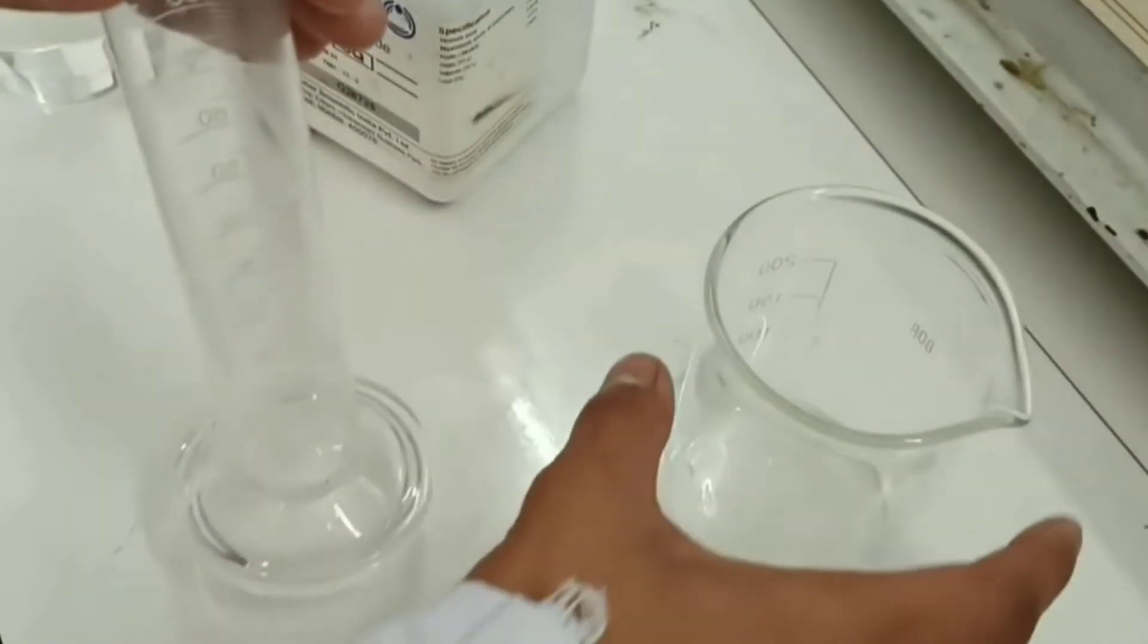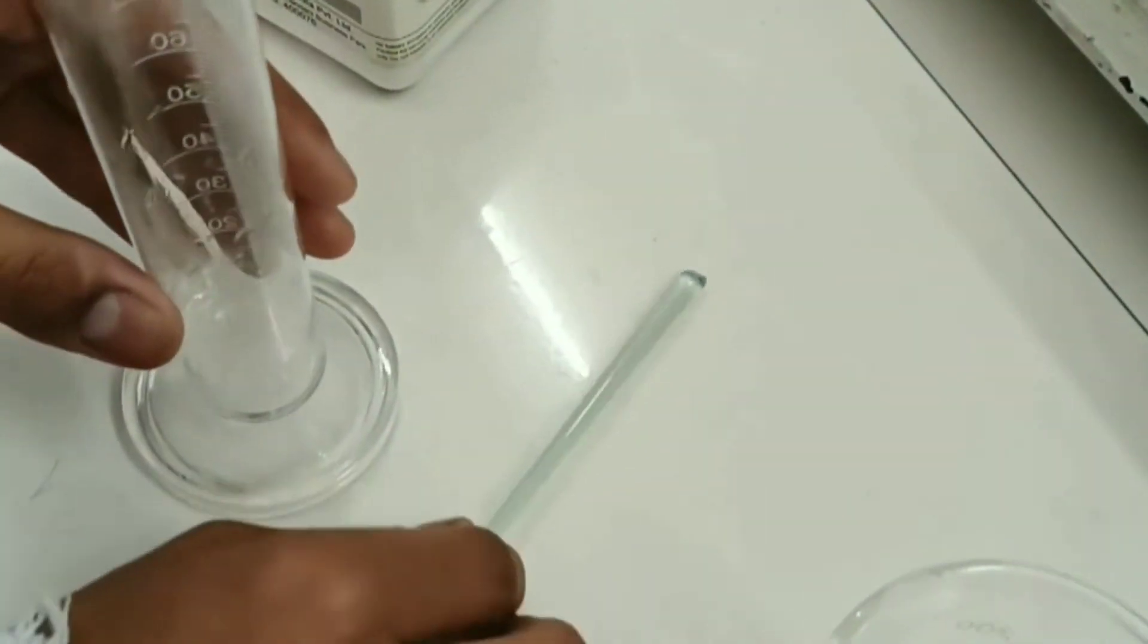The apparatus required for this solution are a measuring cylinder, glass beaker, and glass rod.